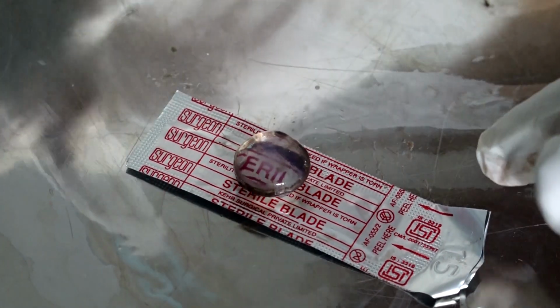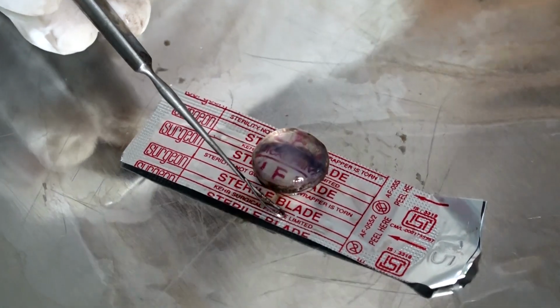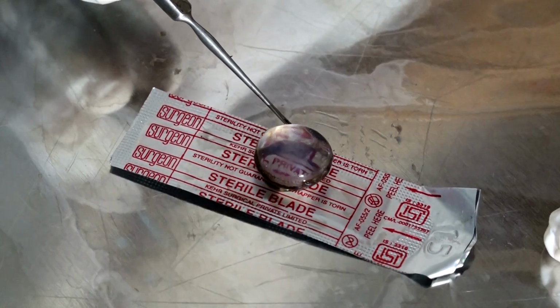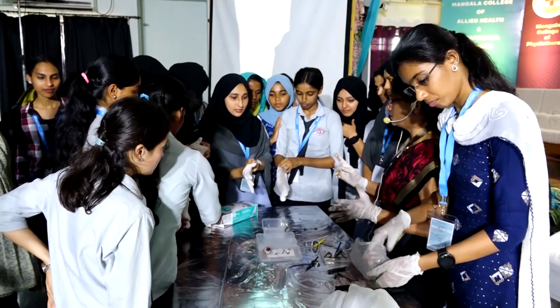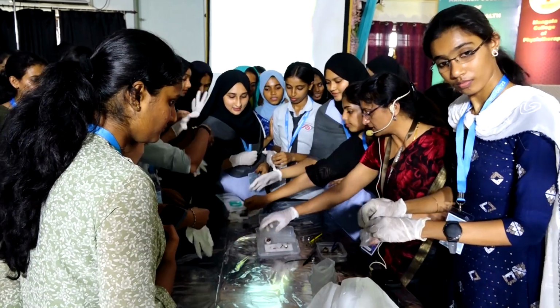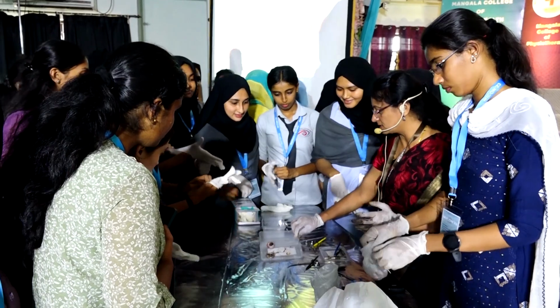I would like to ask whether we have 5 to 10 minutes for you to quickly come and see the structures here, and a few of you can use the gloves and touch the structures and see it. Particularly, don't use both the gloves. So you can feel the whole eye and the other structures also. This is the dissected eye.